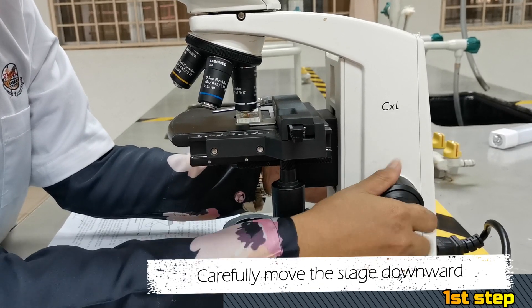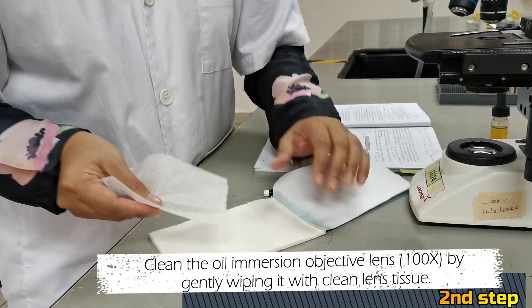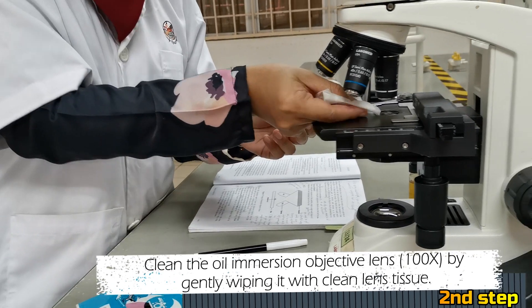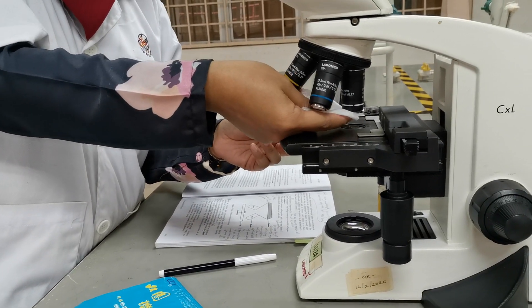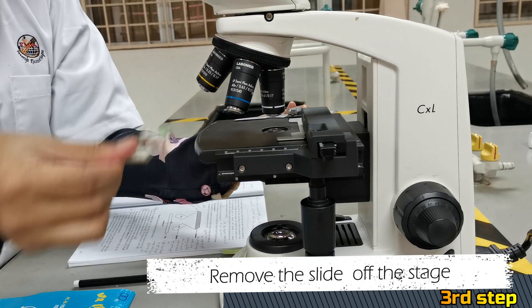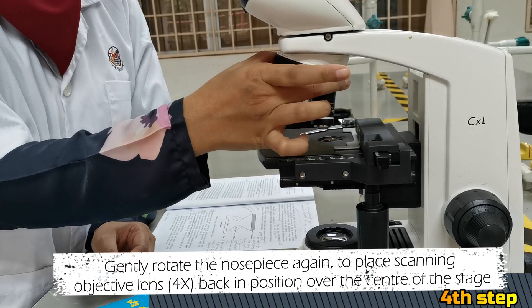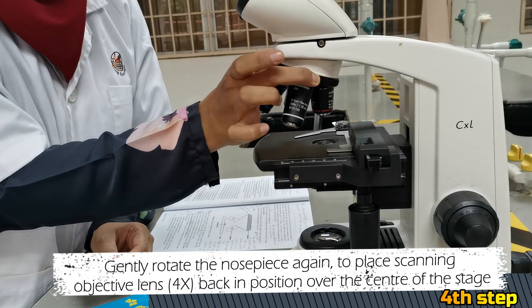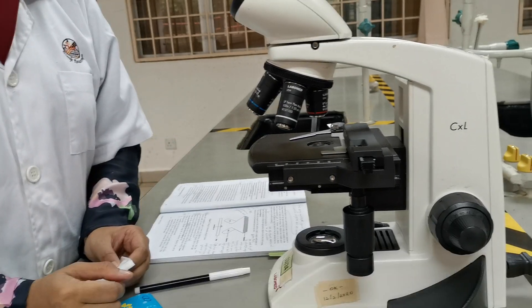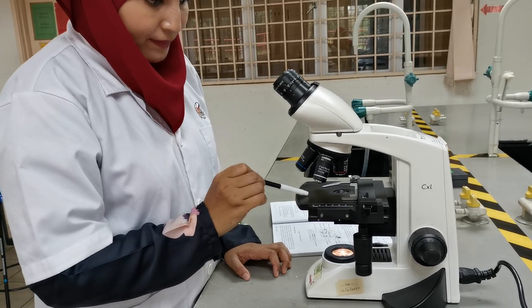First, carefully move the stage downward. Second, clean the oil immersion objective lens by gently wiping it with clean lens tissue. Third, remove the slide from the stage. Fourth, gently rotate the nosepiece again to place the scanning objective lens back in position over the center of the stage. If oil is found on the stage, wipe the oil off with lens tissue.